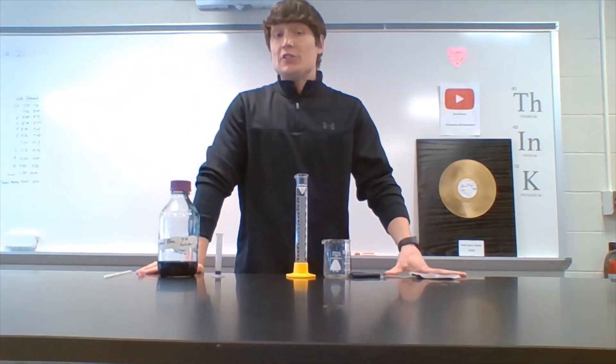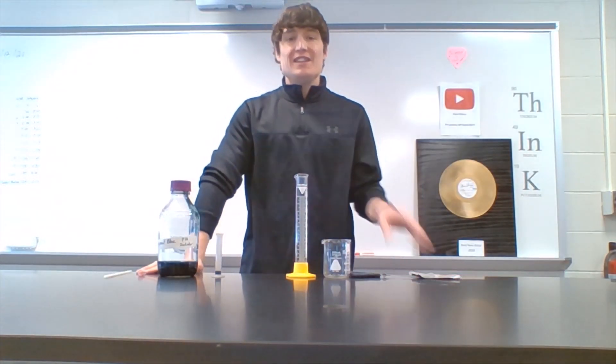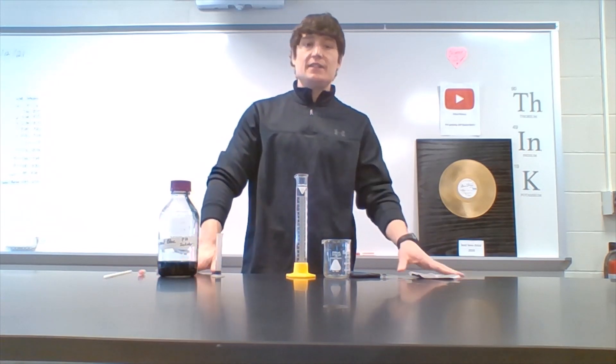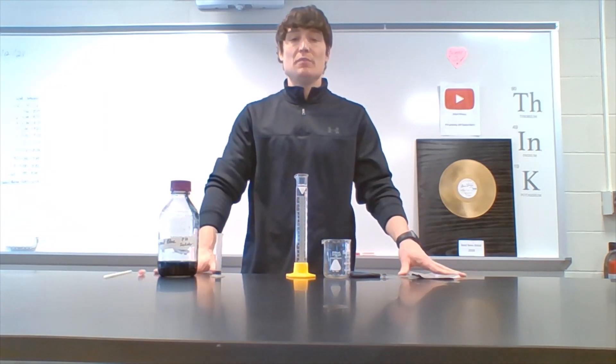Today's topic: cellular respiration — one of the main reasons why you eat and the reason why you breathe. So let's prove that cellular respiration does in fact take place inside the human body.